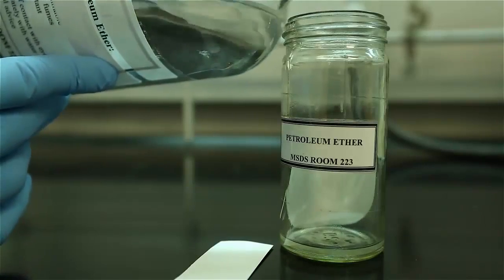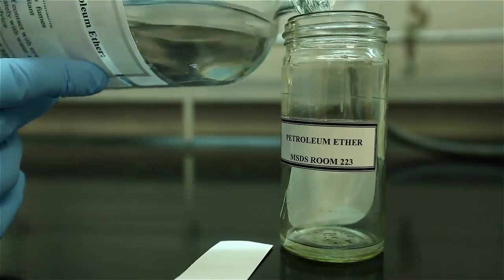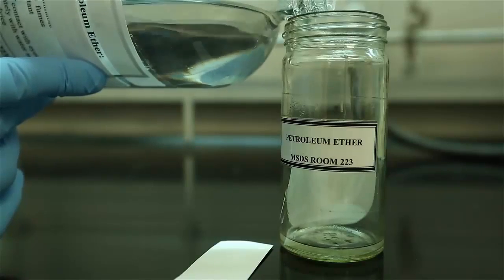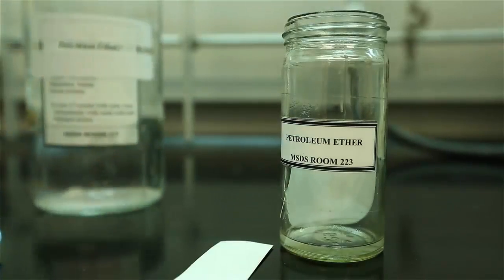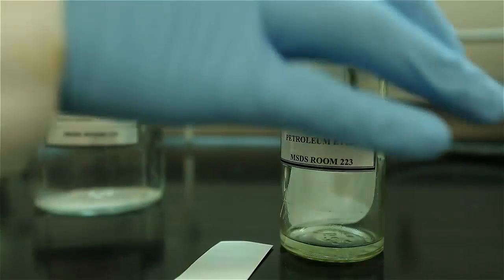The filter paper in the jar acts as a wick to saturate the jar's atmosphere with solvent vapors. If no jar is available, make your own TLC chamber by using a beaker, watch glass, and filter paper.